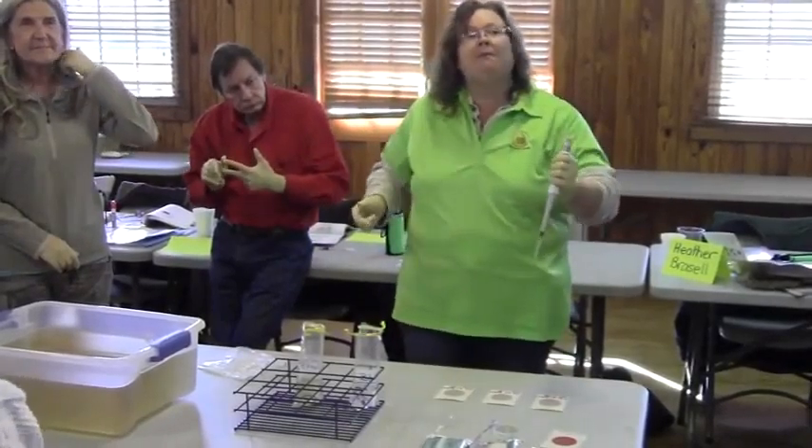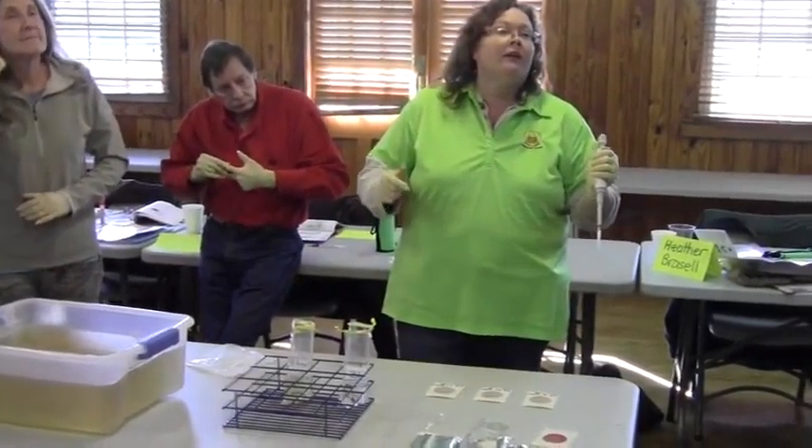But that's only starting with your blank first. You don't want to start with your sample first, because you don't want to go from your sample to your blank — because then you'll get all kinds of goodies in your blank, and then you have to start all over again.